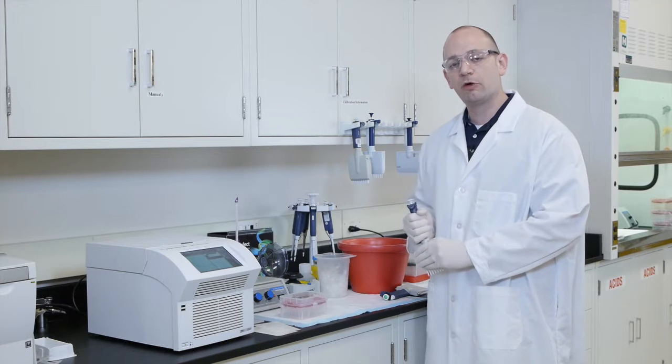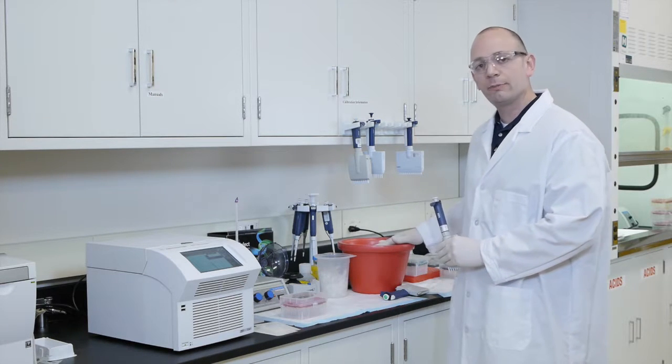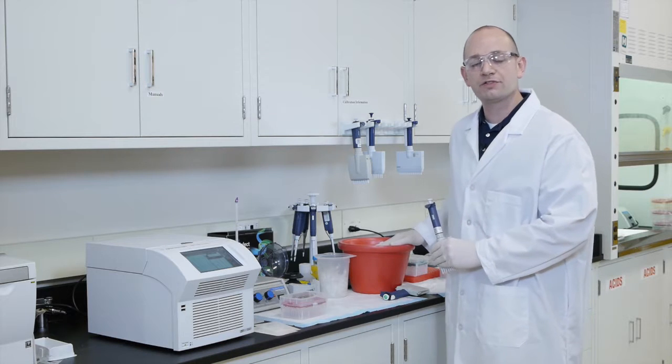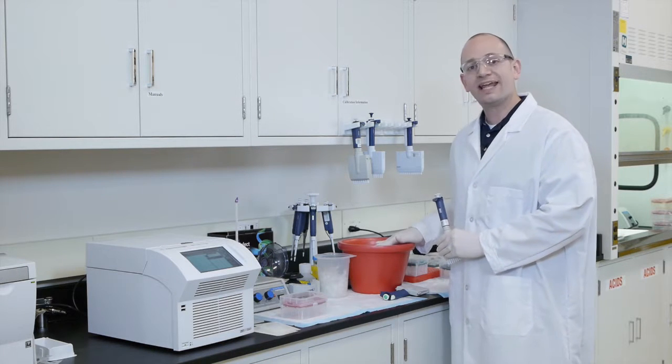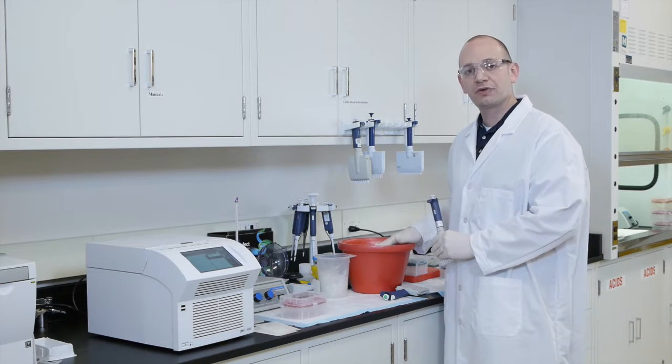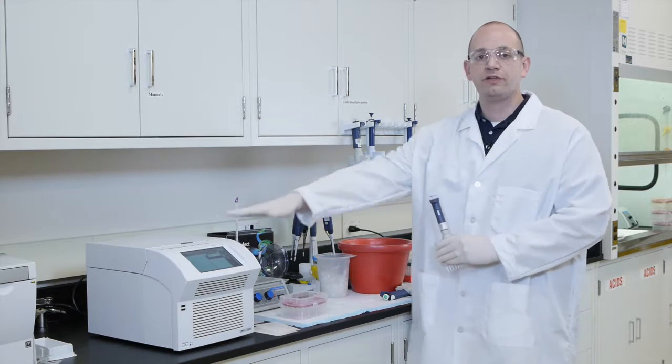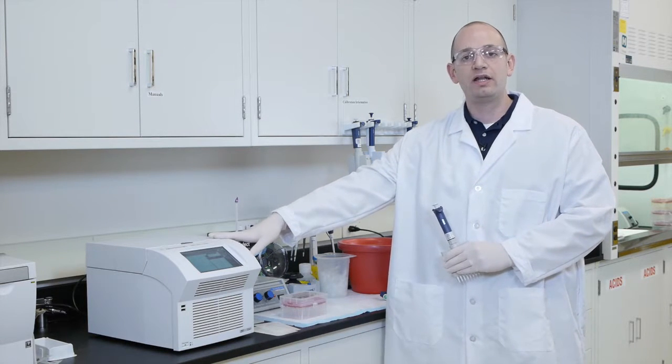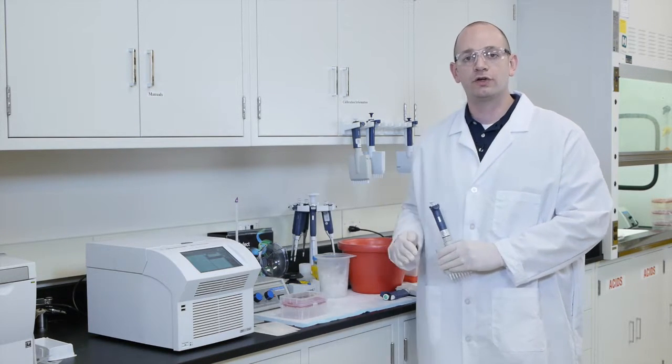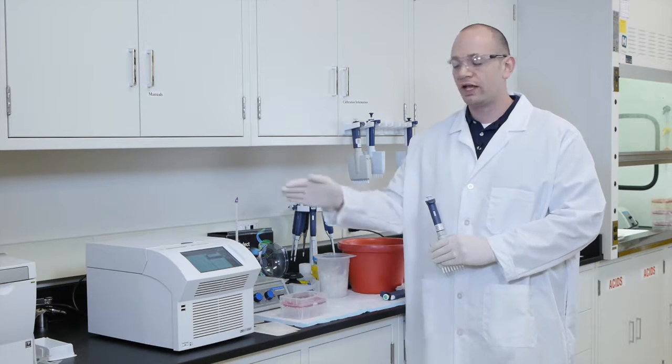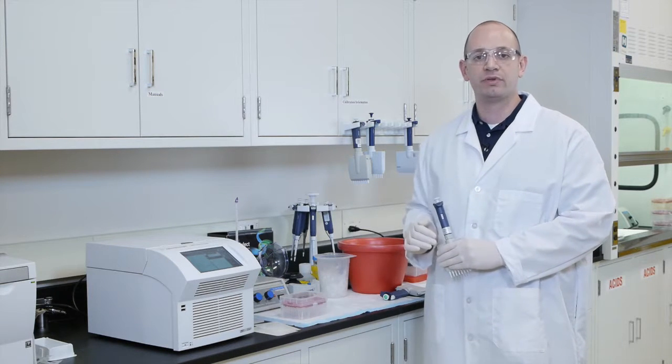Now what I'll be doing is I'll be taking the capture library that's been premixed with RNase block solution, which has been kept in an ice bucket, and I'll be transferring that directly to the PCR plate into an independent row directly under the library that we prepared and put in the PCR plate initially.